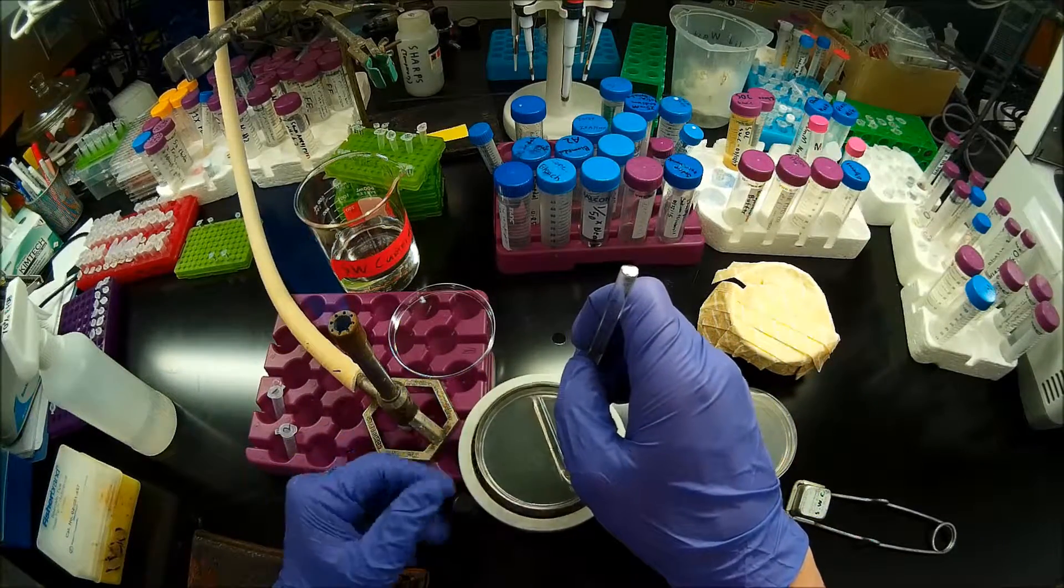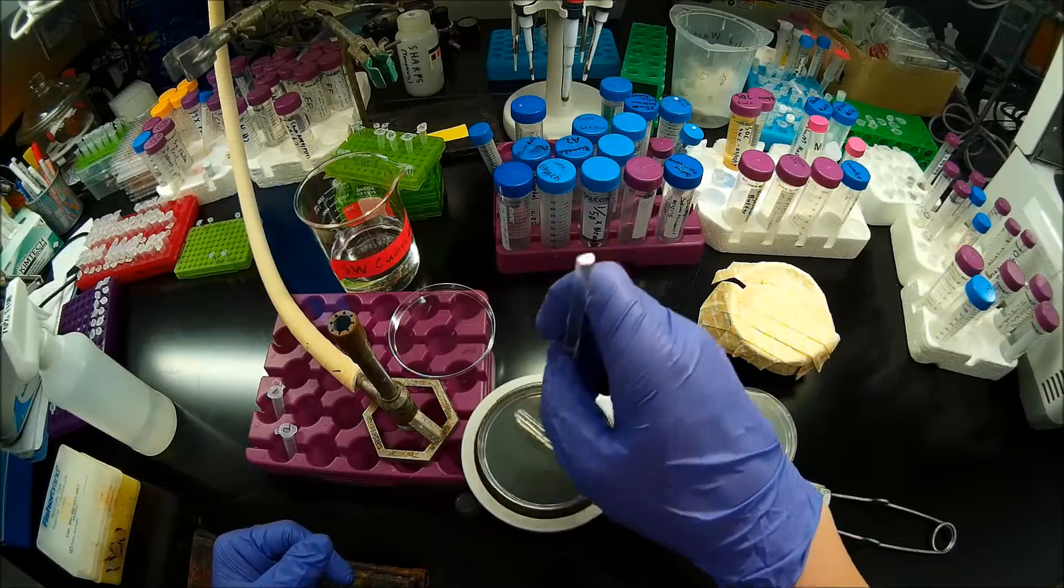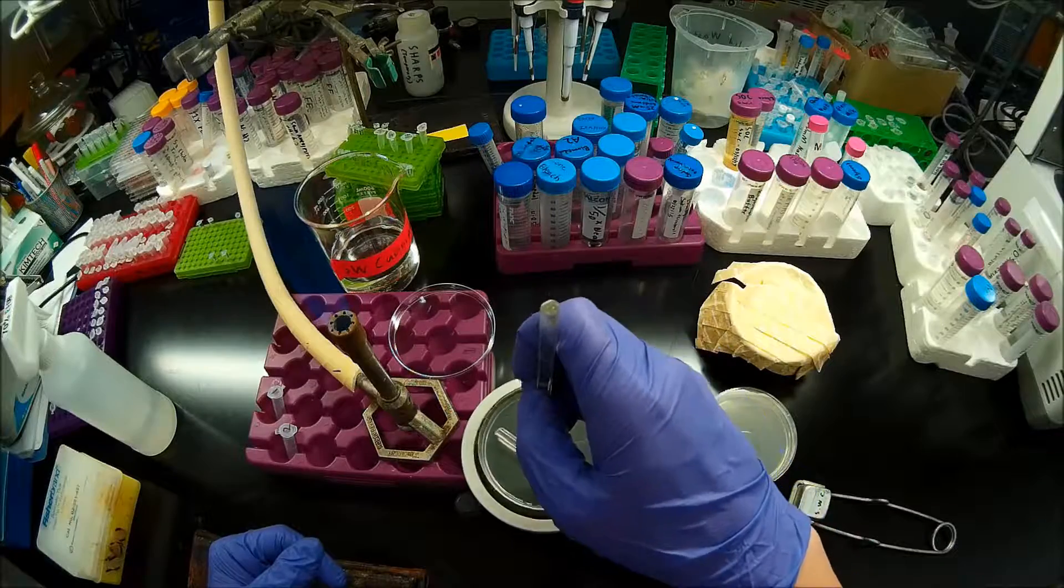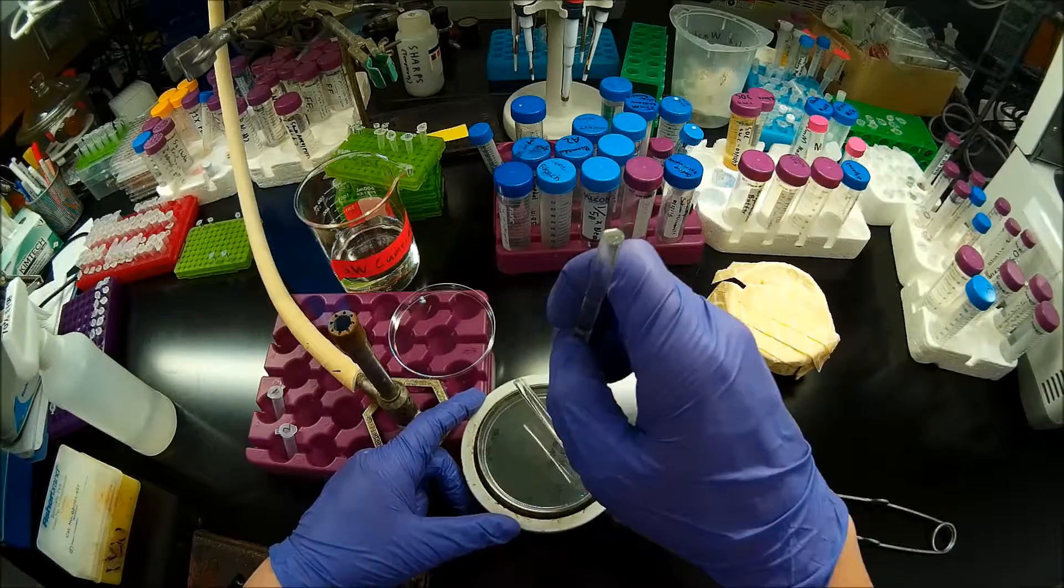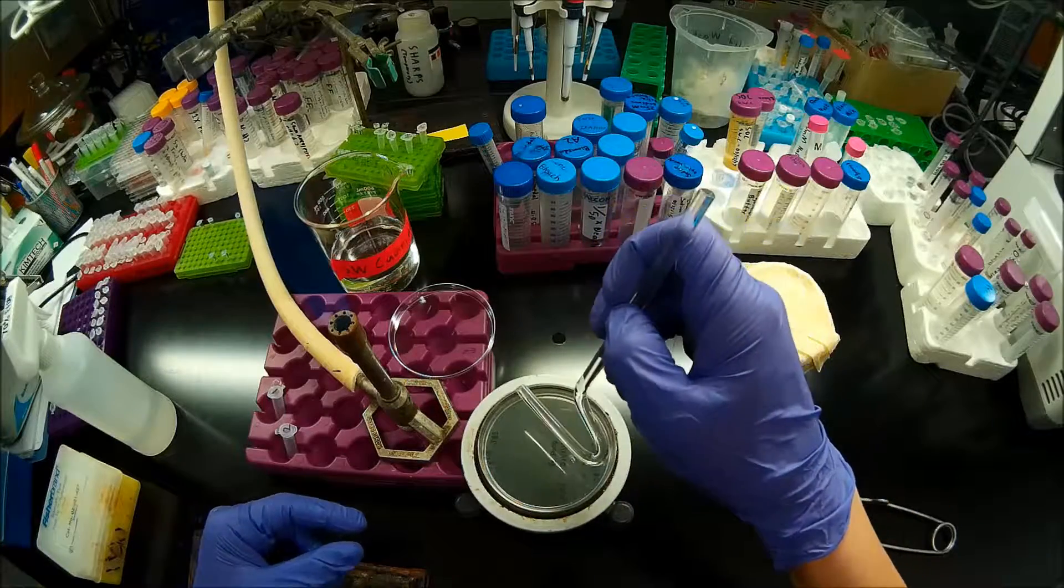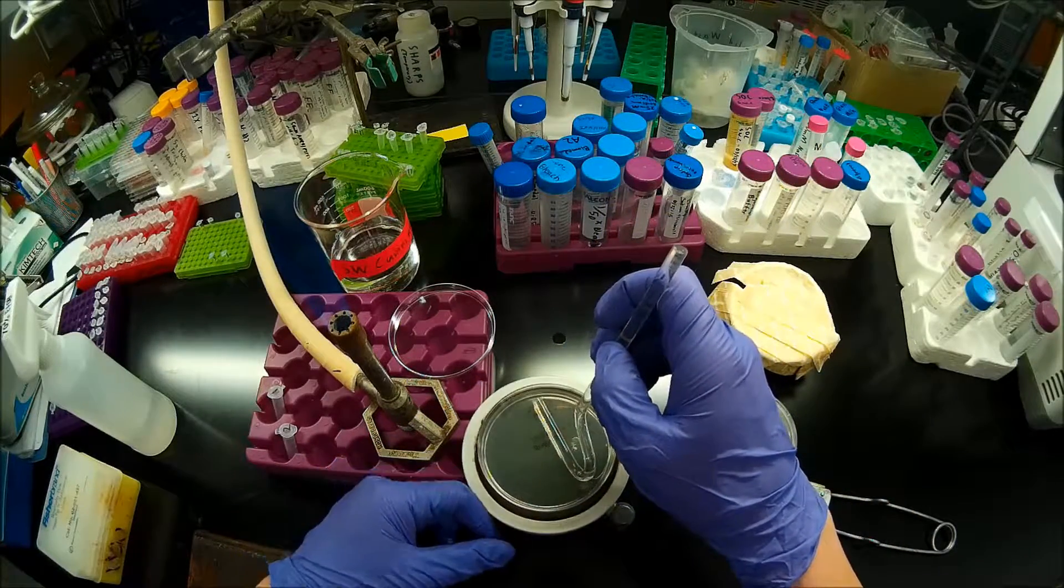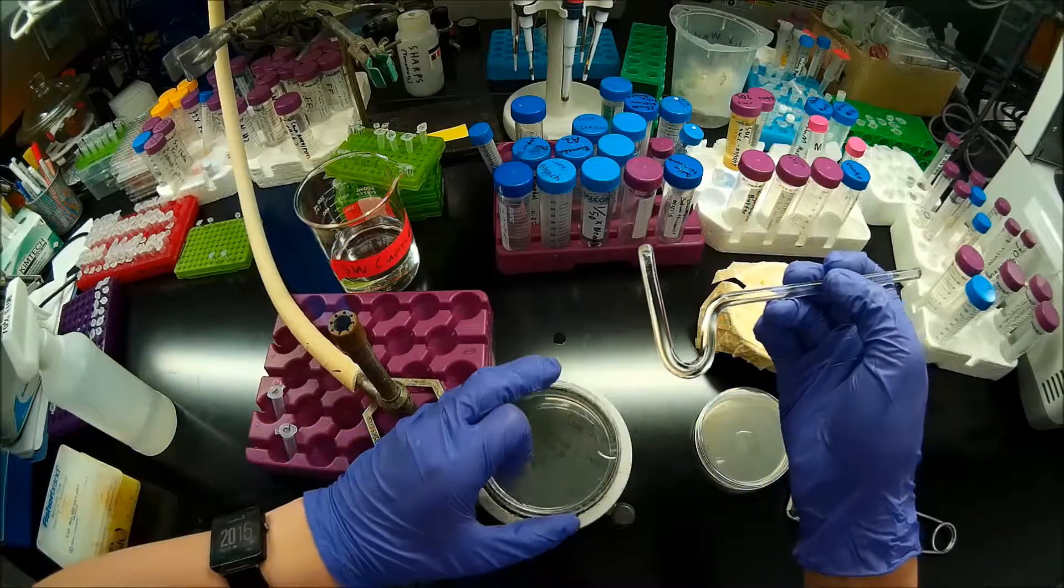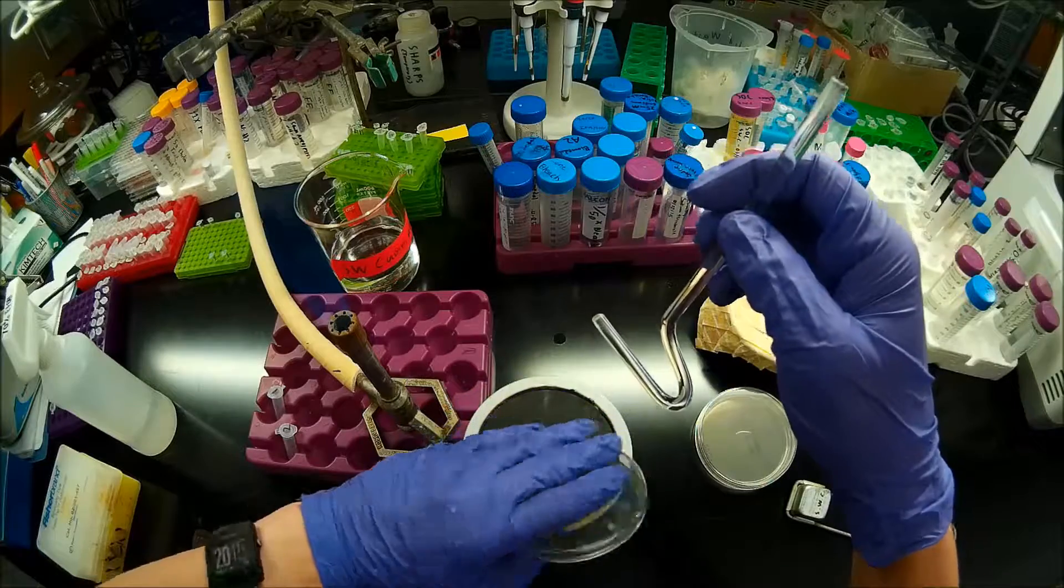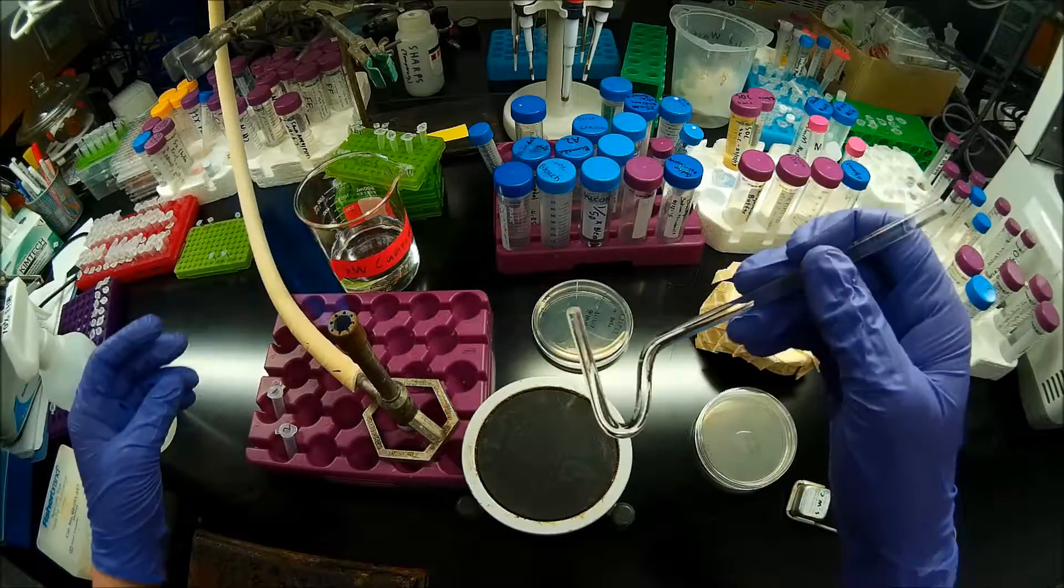So I'll just spin that. Note that I'm barely pushing down here. I'm really just holding my spreader above the plate. If I'm pushing down too hard, I'm going to be applying shear to my cells between the spreader and the surface of the agar. I'm really just letting the weight of the spreader do the majority of the work.